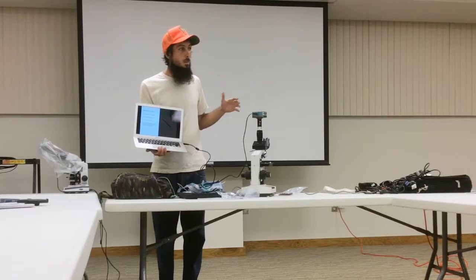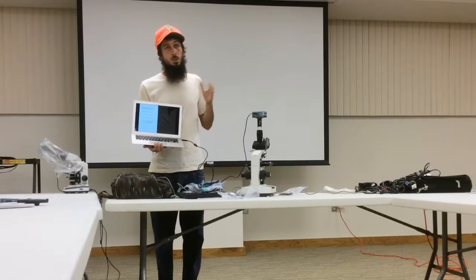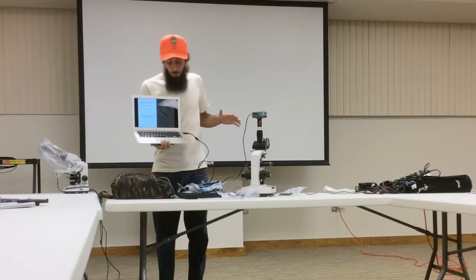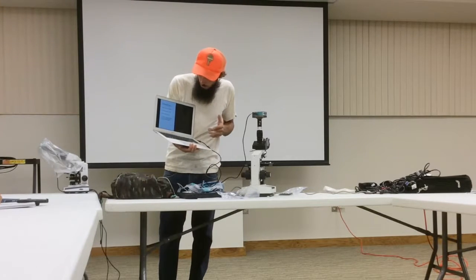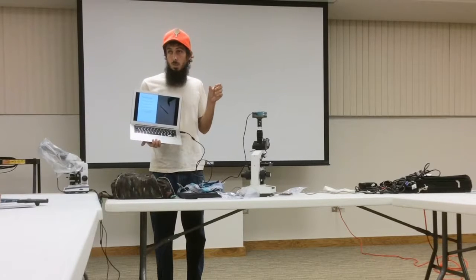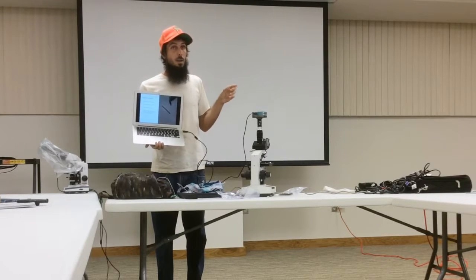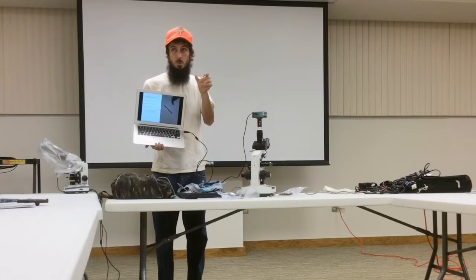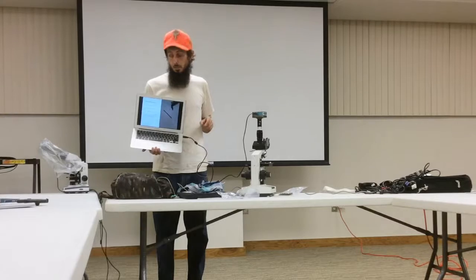Parasitic fungus are clear, whereas beneficial fungus are darker colored. And they're also wider than 3.5 micrometers, so they tend to be wide in the soil. They may break into chunks, but they'll always be really nice and wide.